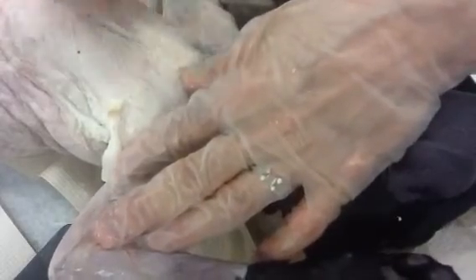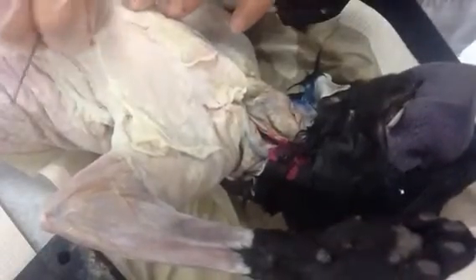It's not necessarily an easy job. I really like teasing needles because if you tease, you can get an edge of some connective tissue and give it a good yank, and you can peel quite a bit off that way. Those teasing needles, or dissecting needles — I like to call them teasing needles — they really are helpful because they're not going to do so much damage that you're really into your deeper layers, but they're going to give you enough of a head start. You can peel a layer at a time to get this outer layer.